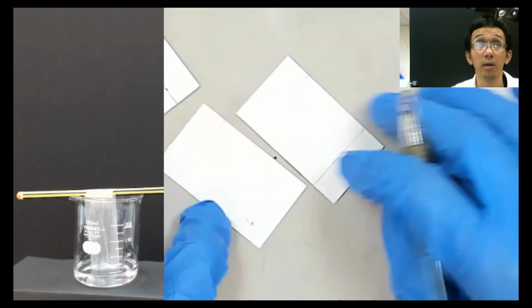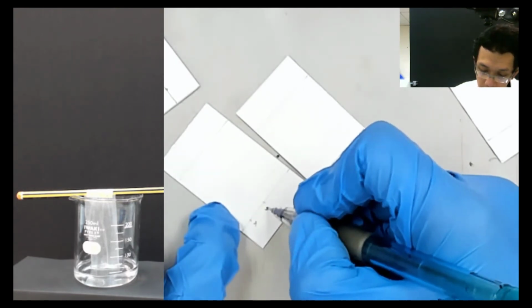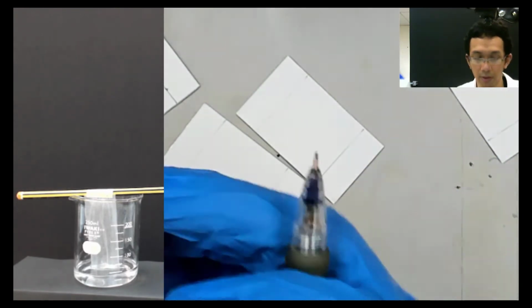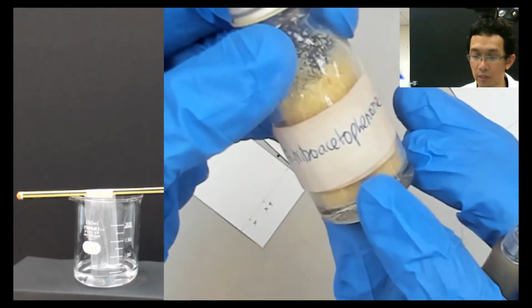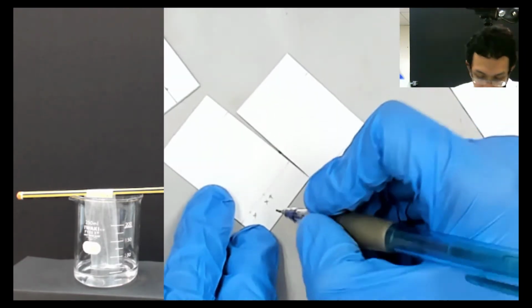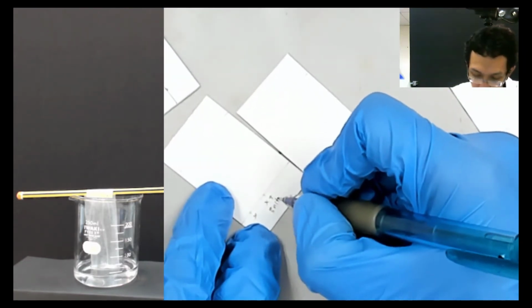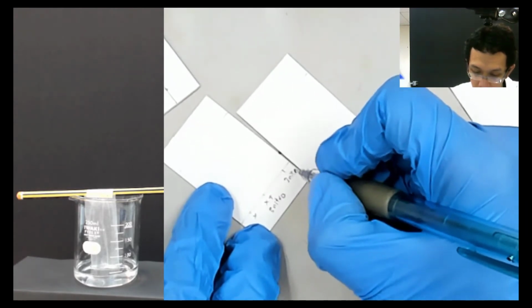Okay, so I will put X, and then in the middle I put X plus, maybe. So in group 2 they have 3-nitroacetophenone. So you put 3-nitro like that, and then this is 3-nitro. So just get the idea.